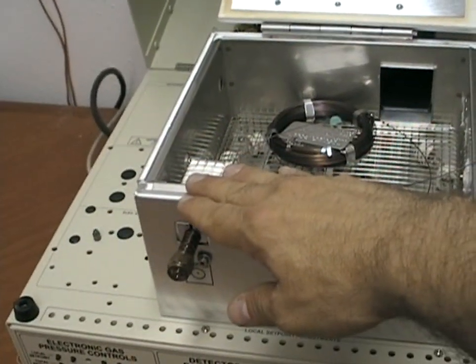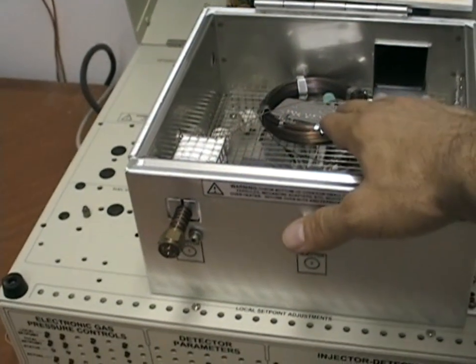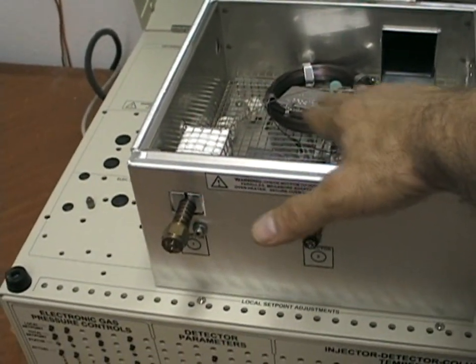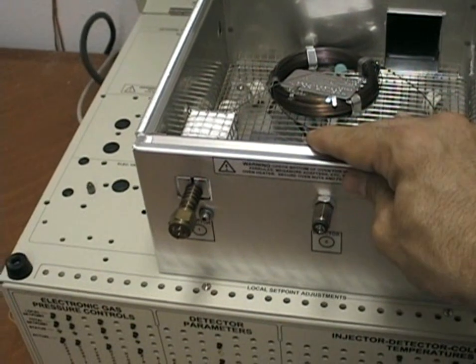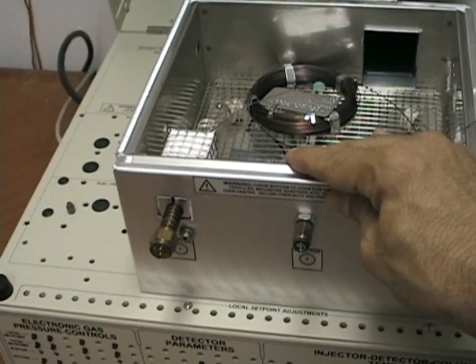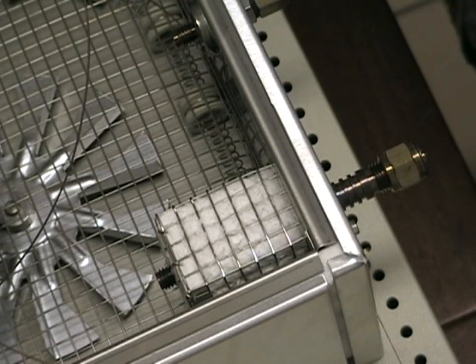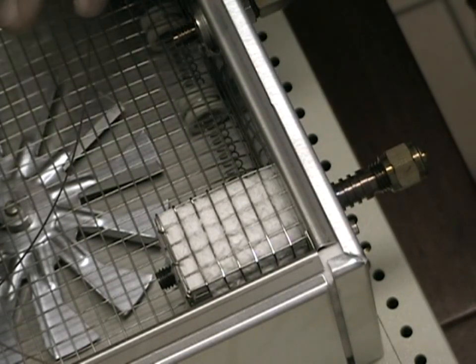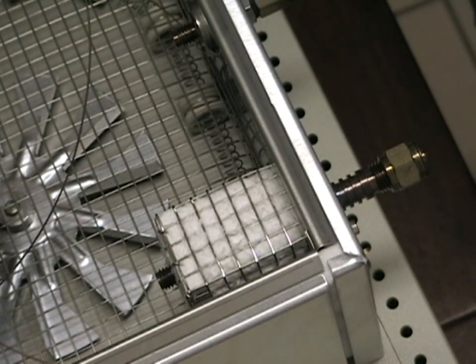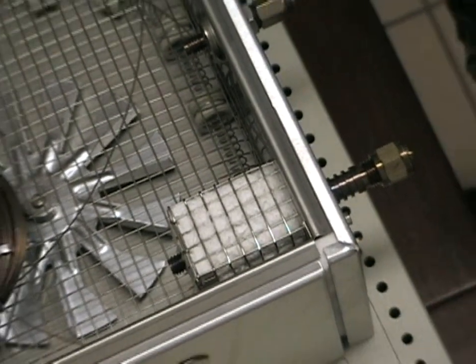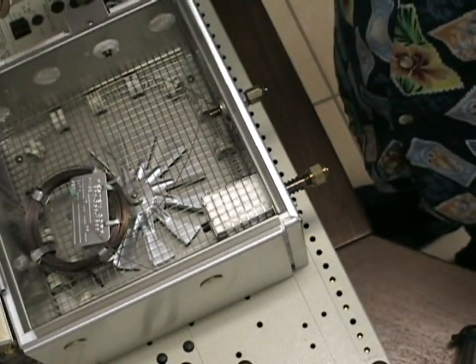This is the heated injector and we will now show how to connect a capillary column to the heated injector to do your analysis. When the system is first installed, it is necessary to connect the column to the injection port.